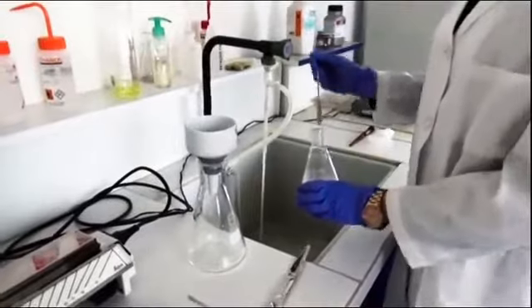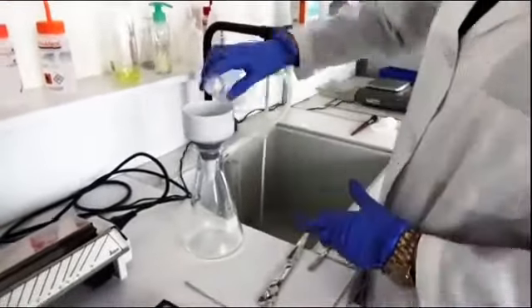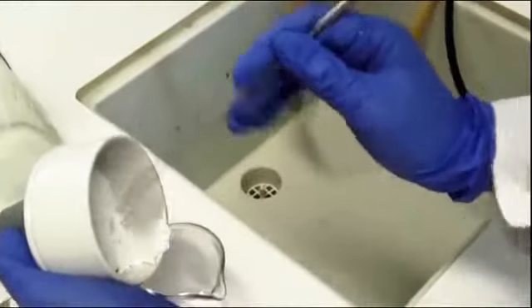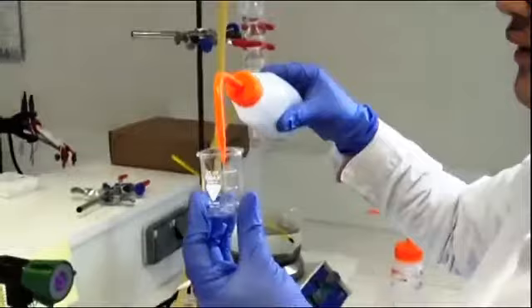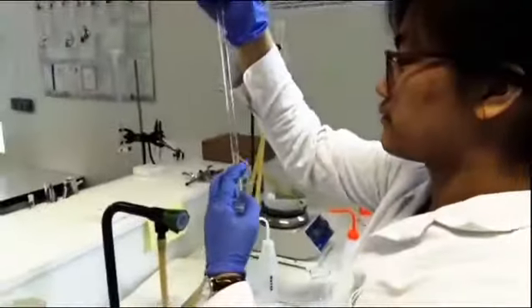Secondly, to collect the aspirin, we filtered the crystals with a Buchner. The result is a powder. We could think it's aspirin, but in reality it's not. The crude aspirin obtained is not pure. To wash off the impurities, we poured 10 milliliters of 95% ethanol.